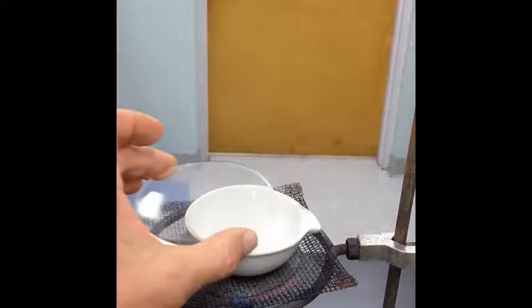We'll continue to heat this until approximately 2/3 of the volume has evaporated. And once we're down to about 1/3 of the initial volume of the water in the evaporating dish, we will then place the watch glass over the top of the evaporating dish so that any splatters of salt solution that are coming from boiling it will stick to the watch glass, and we won't lose them and won't lose that mass of the salt.